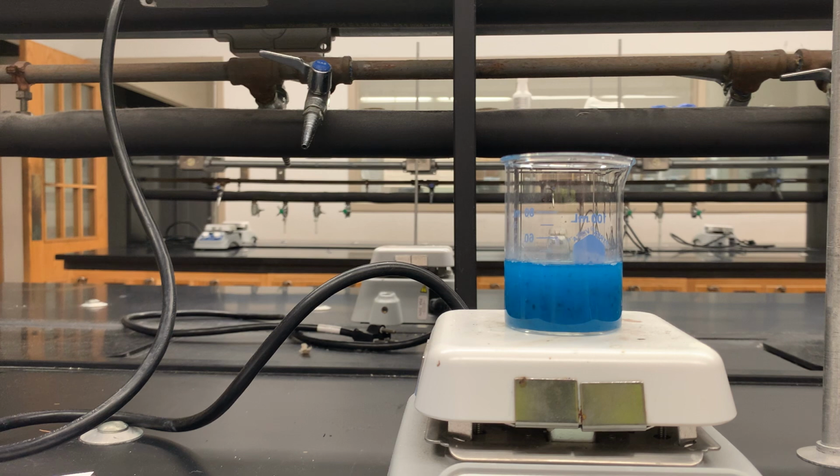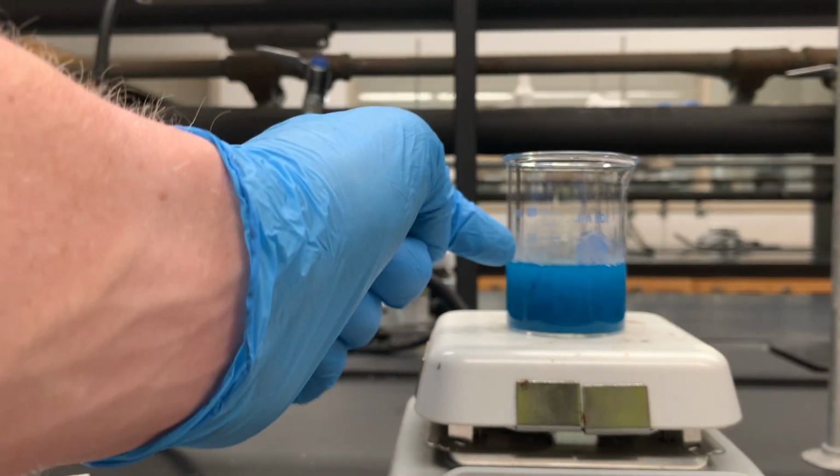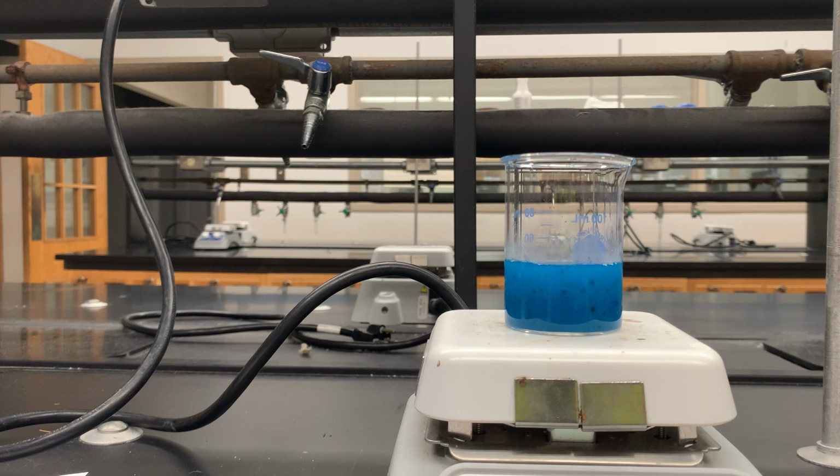One thing that's important is as you look at your temperature on your hot plate, it will continue blinking until it reaches the desired temperature. Mine continues to blink. I can see that my solution's getting hotter because I've got condensation on the interior of my beaker there. But this does not really require an extremely dramatic level of heat or anything like that.